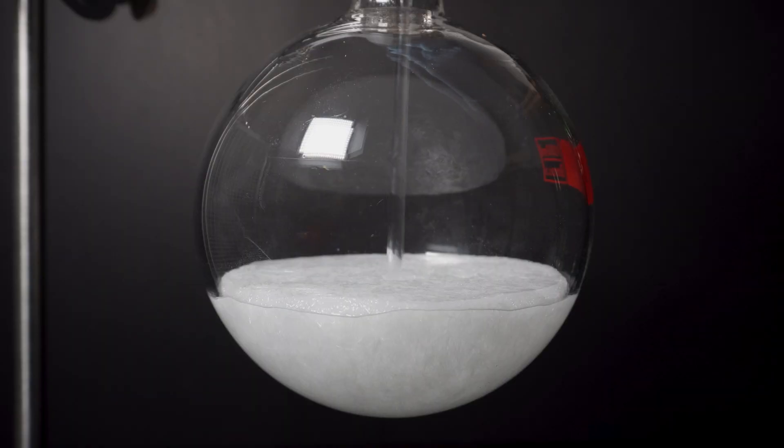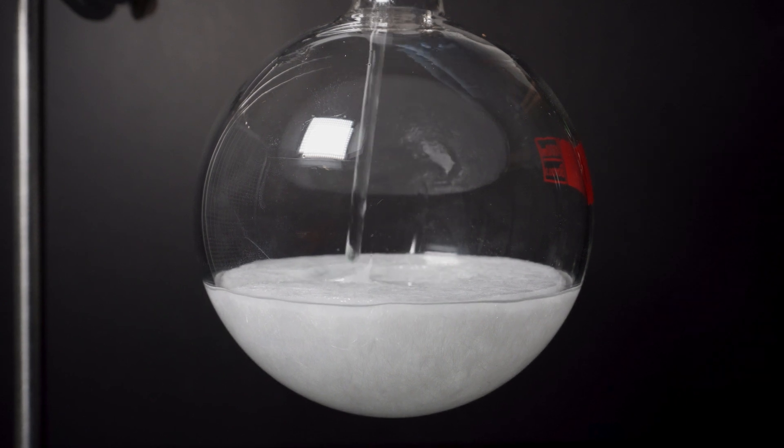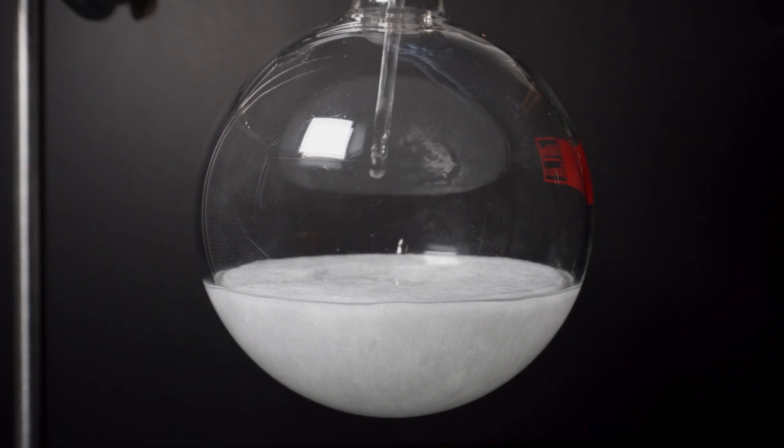From here I start to break up the crystals with a glass stir rod. They are incredibly soft and fluffy crystals.